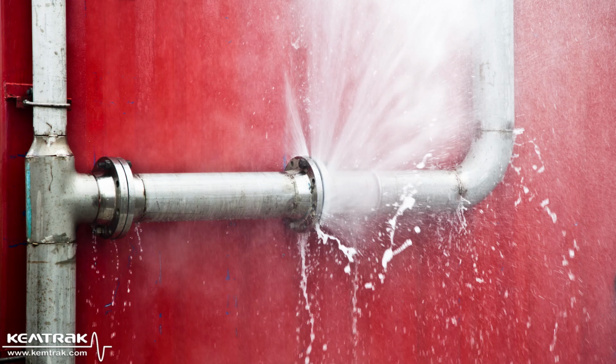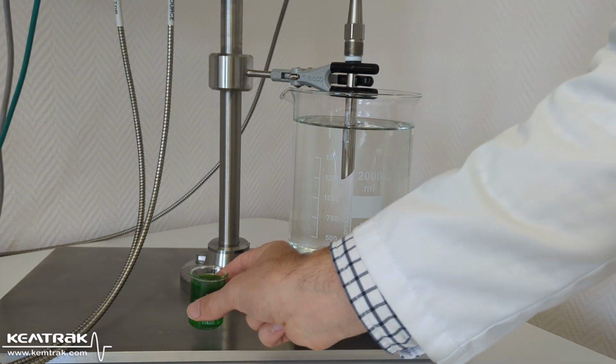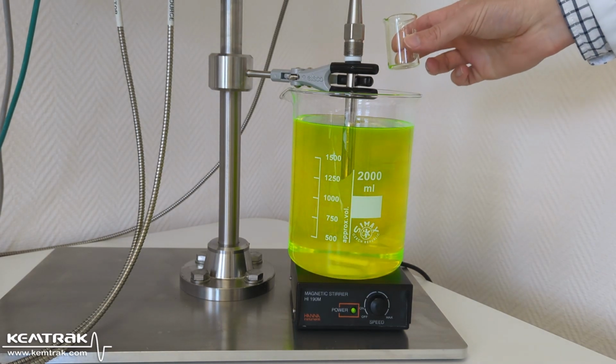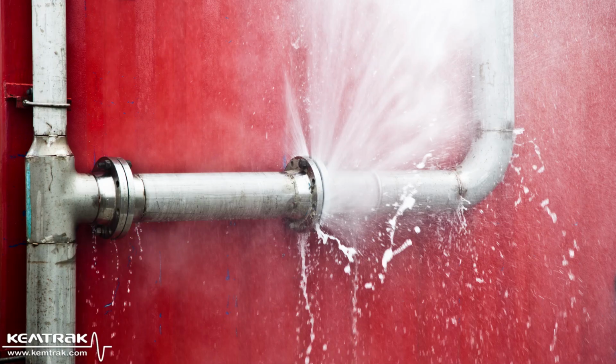Unfortunately, we see that some customers use bulk measurement techniques such as density or refractive index to detect leaks. If I were to use refractive index, I would need to add the whole content of my small beaker containing the fluorescent dye to get a signal. In this case, by the time you have detected the leak, it could already have killed someone. With this method, only catastrophic leaks of 1% ethylene glycol can be detected, telling you when it's already too late and the product has already been shipped.